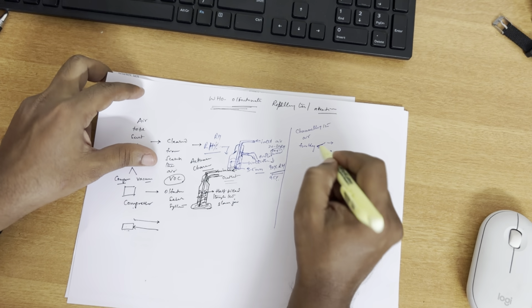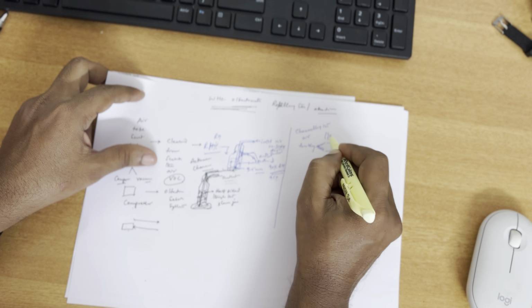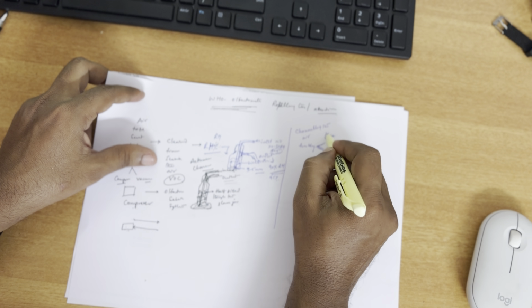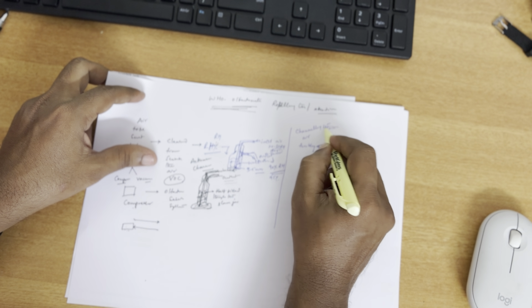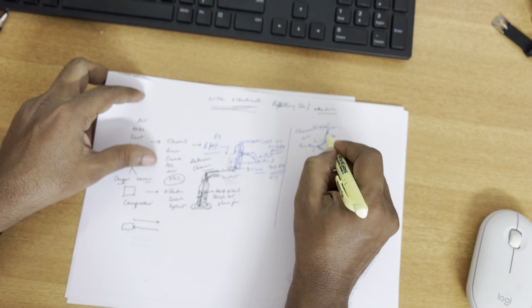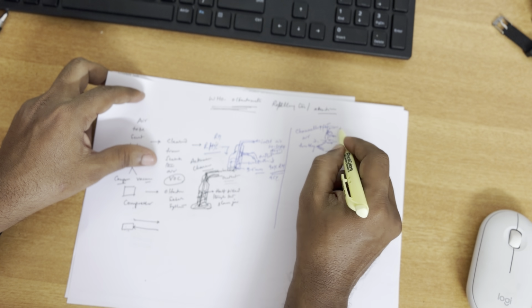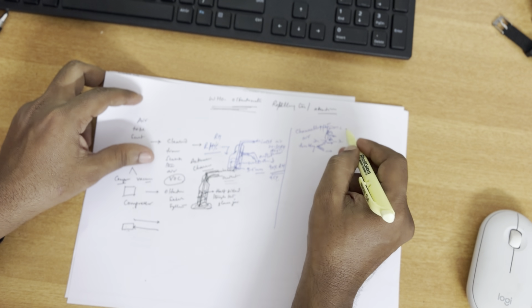If you are looking for four-way, you have to add a connector. This acts as an inlet, and the air is divided into two parts. From here you put one more extender, so the air is again divided into two more parts. So 1, 2, 3, 4. The air is first divided into 1 and 2, and then each can be divided again, so a total of 4 ways.